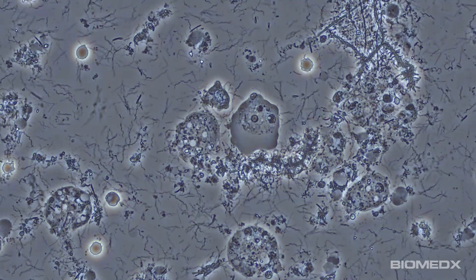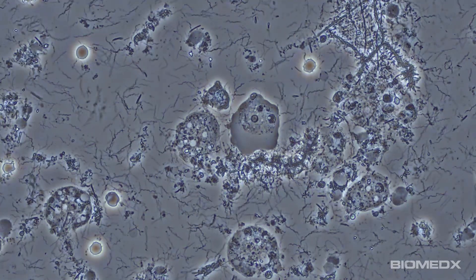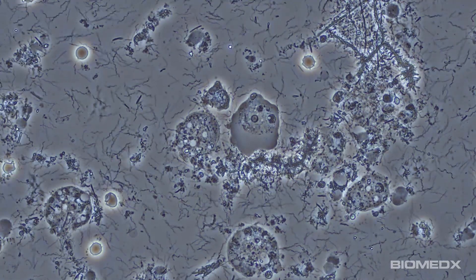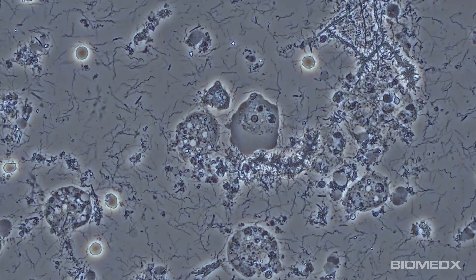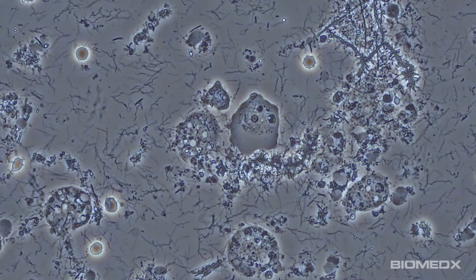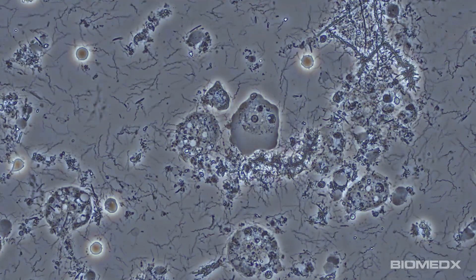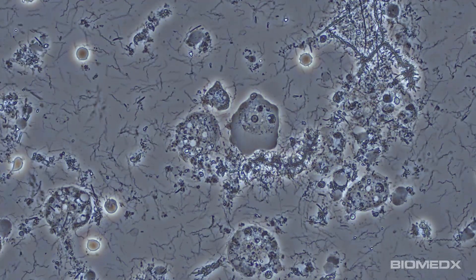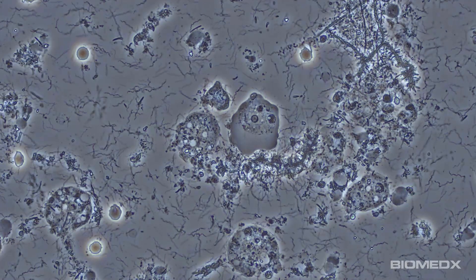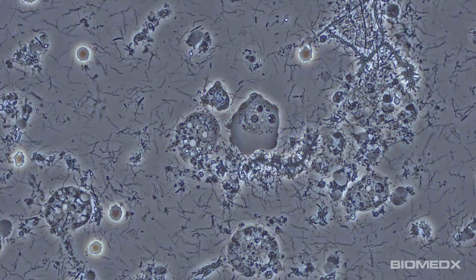In the lower left section of the screen, you will note the spirochetes having a field day pushing and pulling on one of the red blood cells. In fact, seeing red blood cells themselves in a gingival sample is a sign of possible gum inflammation.